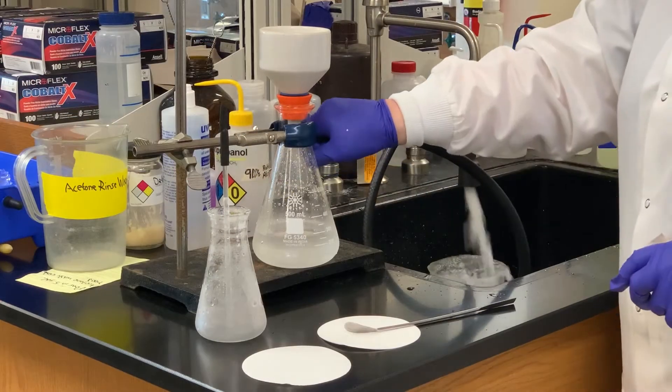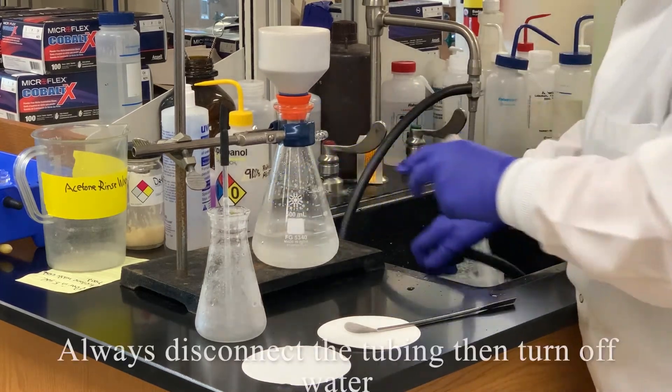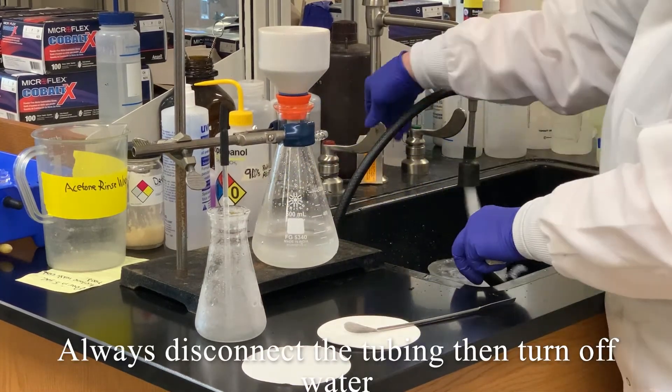I'm going to go ahead and disconnect the vacuum. Remember always to unplug or remove the tubing first.